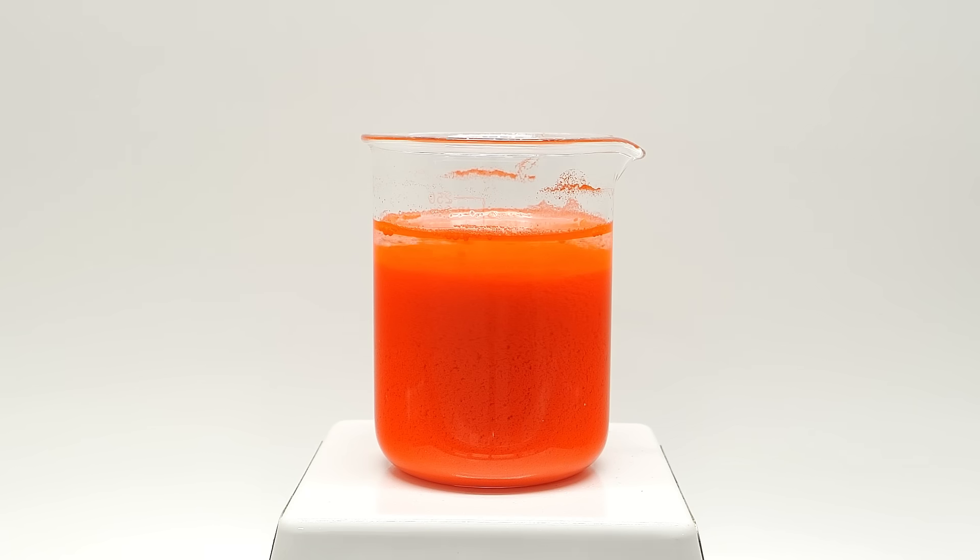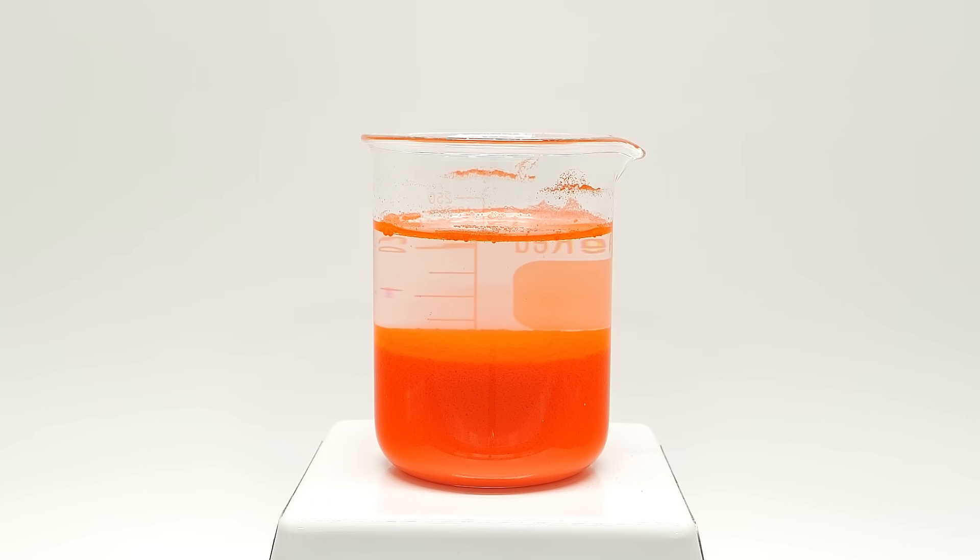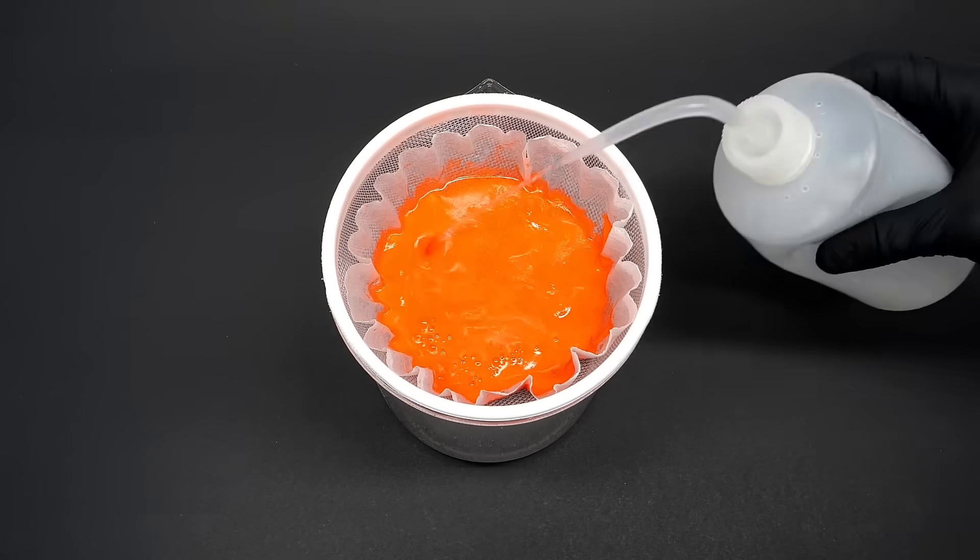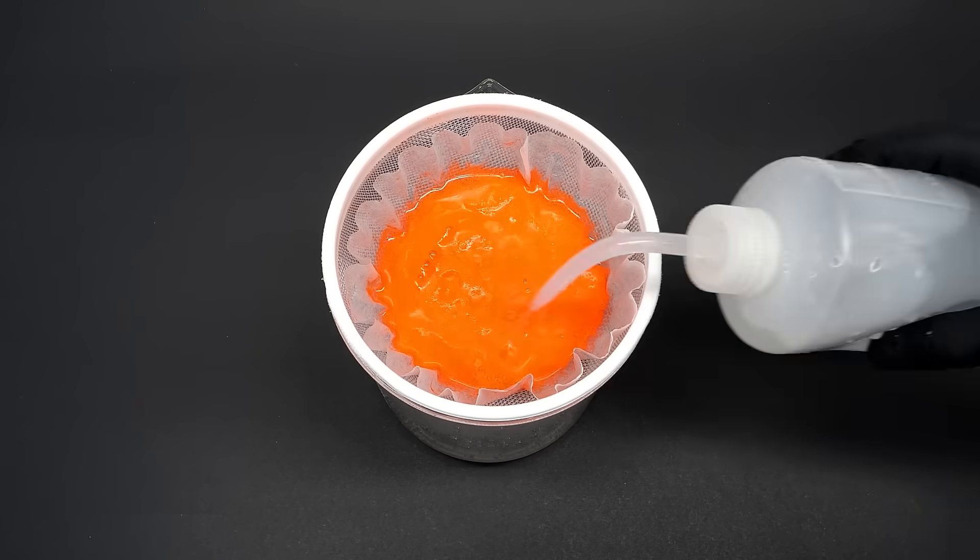The really dense mercury iodide quickly sank to the bottom, and the next thing I had to do was filter it off. So, I poured it all into a coffee filter, and I washed everything a few times with some extra water.